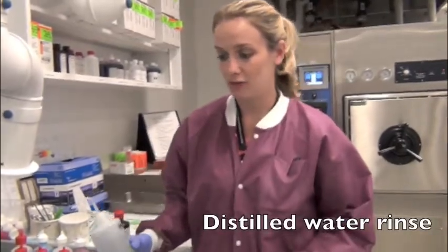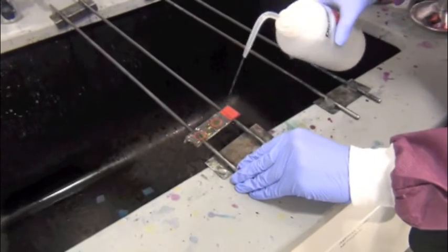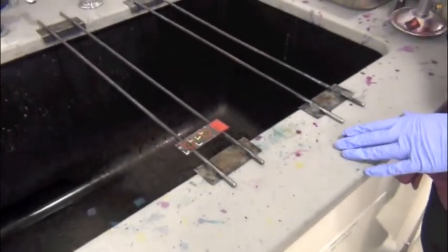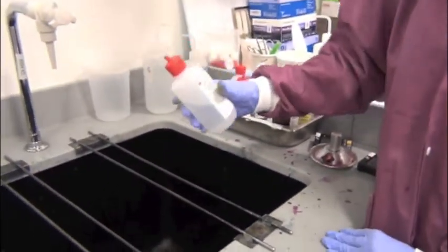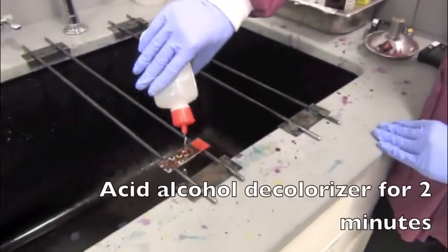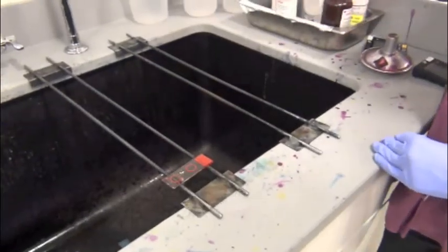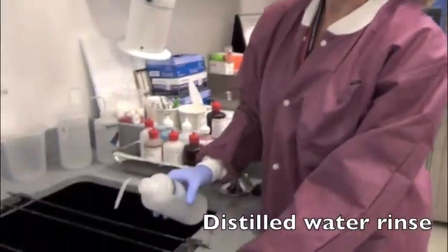After the auramine O has been on for 15 minutes, rinse again with distilled water. We use another acid alcohol decolorizer, and that stays on for 2 minutes. After your decolorizer has been on for 2 minutes, rinse again with your distilled water.